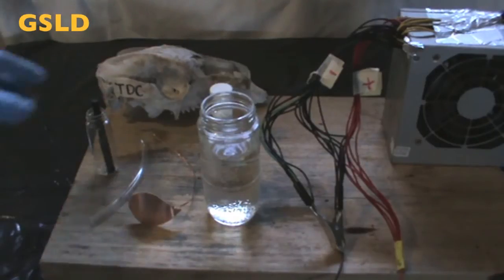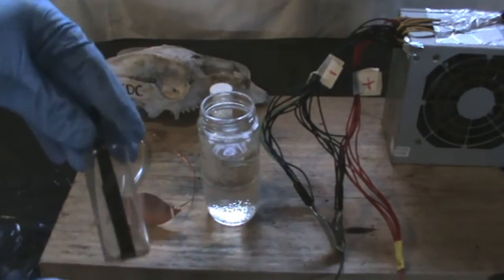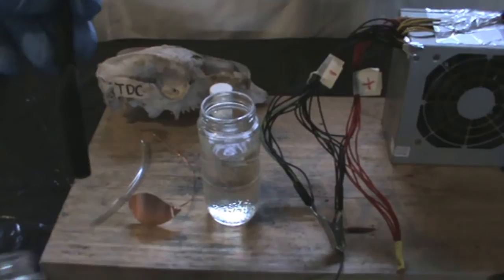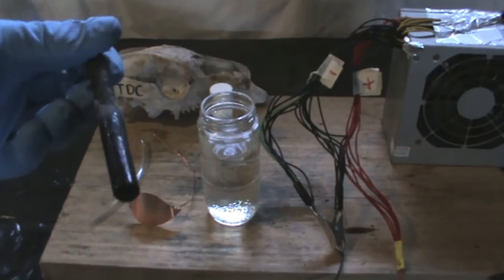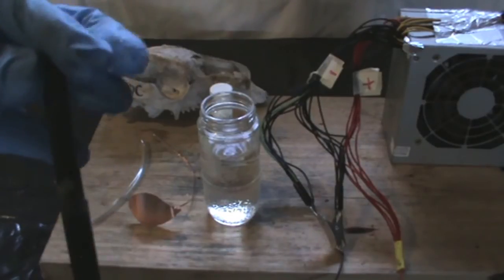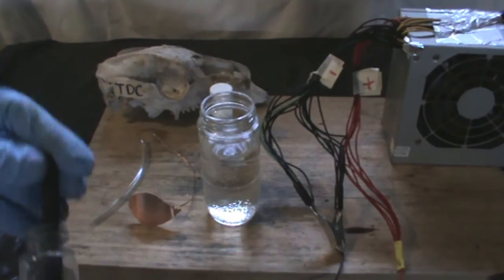First, get a graphite substrate lead dioxide anode from the previous video I made. Notice the top part of the electrode is broken. This was because I accidentally dropped it, but this shouldn't be a problem as that part of the electrode is not going to be submerged into the solution.